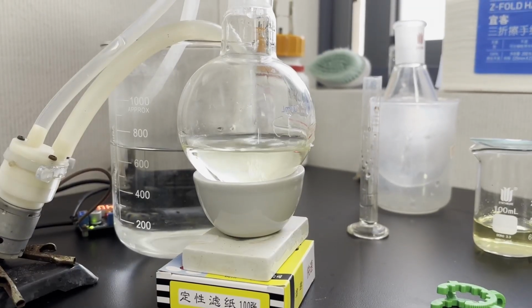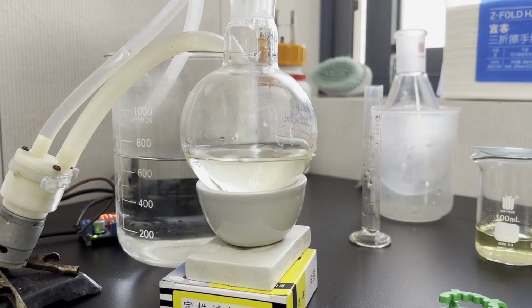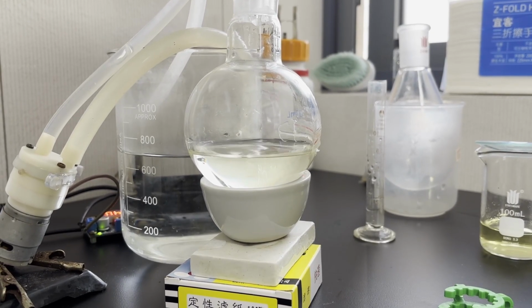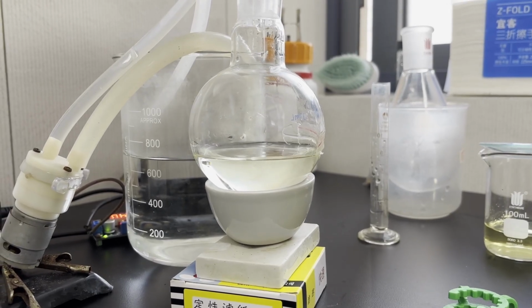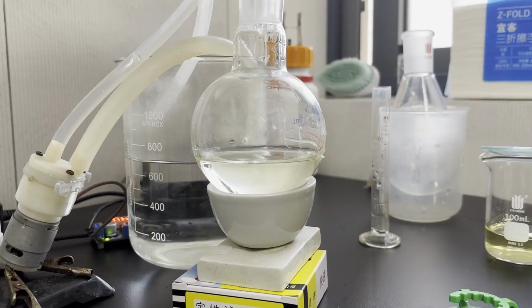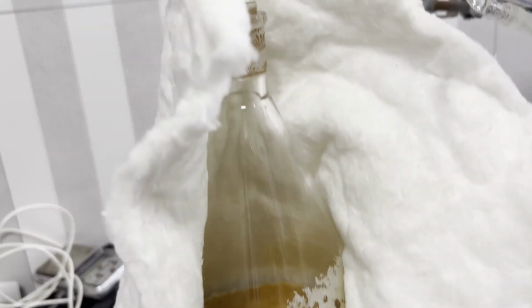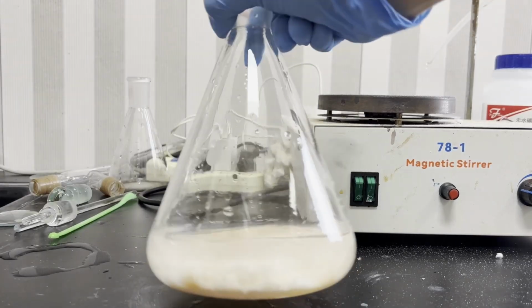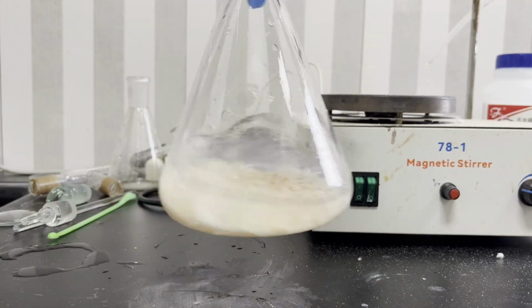However, since I didn't use a thermometer, I had no idea if this acid was azeotropic or not, and from the density difference lines you can see here, the acid in the flask was certainly not yet azeotropic, and the acid dripping in it probably is. So I switched the receiving flask again to collect this azeotropic acid. Soon, nearly everything distills over, and a large cake of salt is left in the flask, which was surprisingly easy to dissolve out, unlike the hydrochloric acid and nitric acid runs, probably because the cake is more porous.